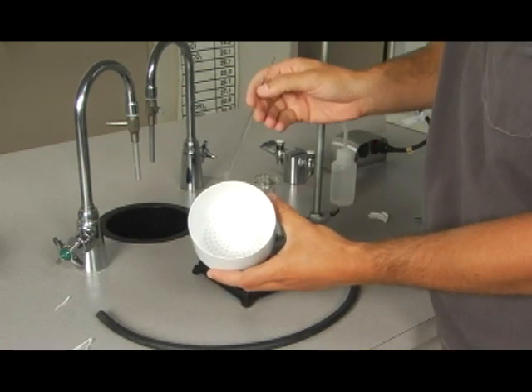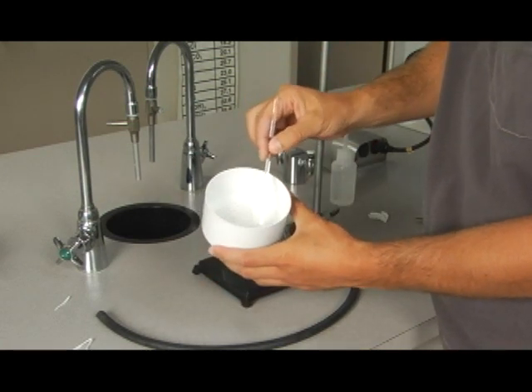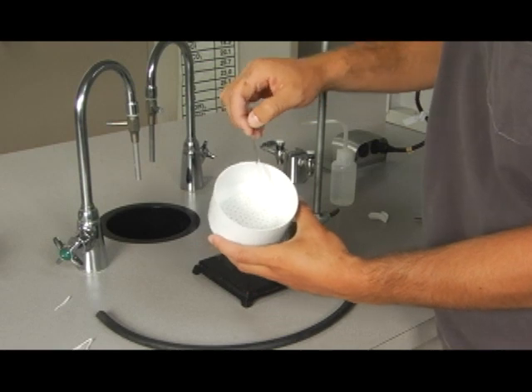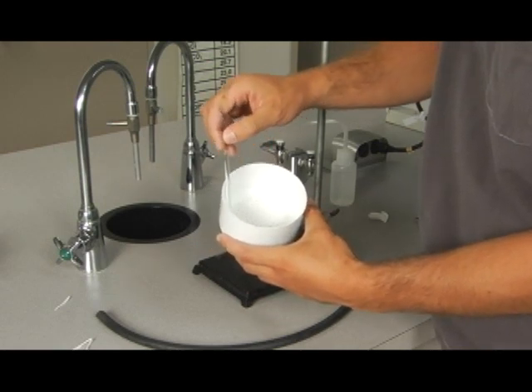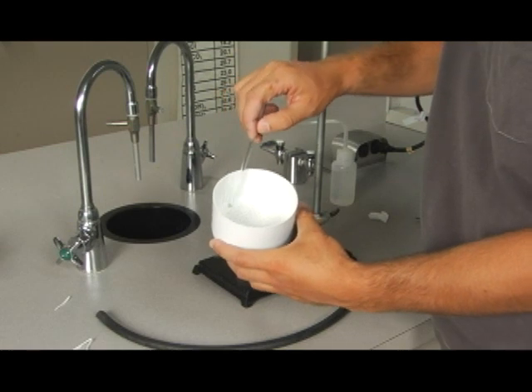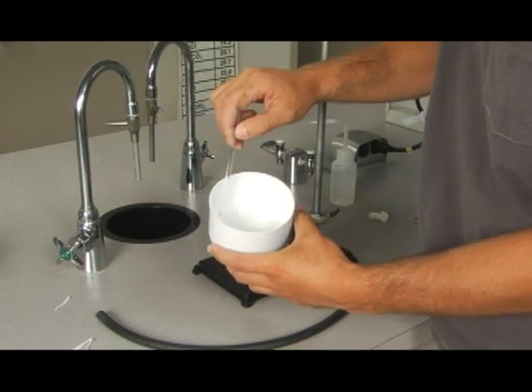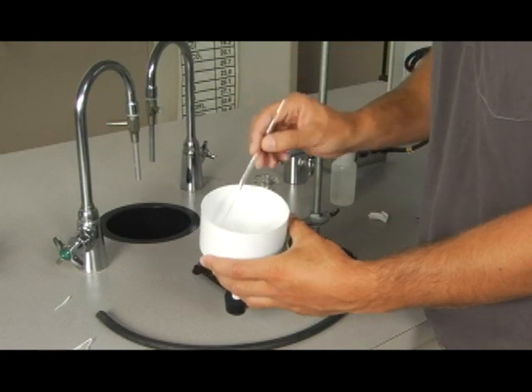Put it down on the filter. It's important to take a glass stirring rod and make sure that there are no bumps or crinkles in our filter paper. What the paper does is form a seal over all of these holes. That way nothing slides past the paper.